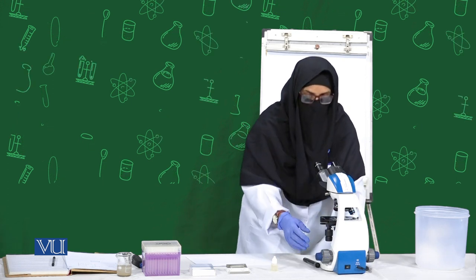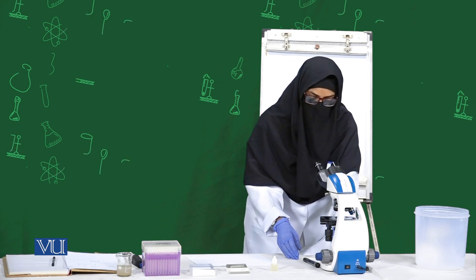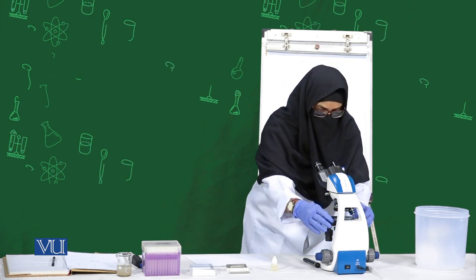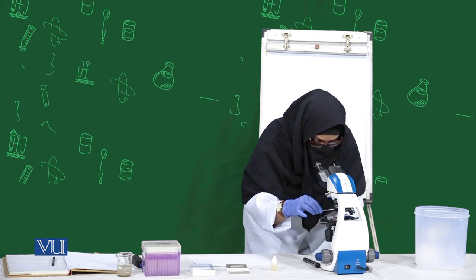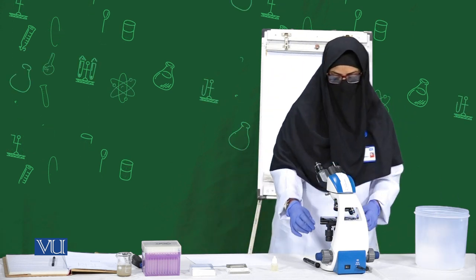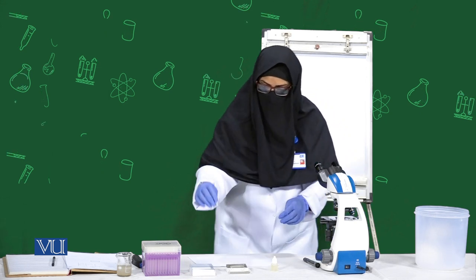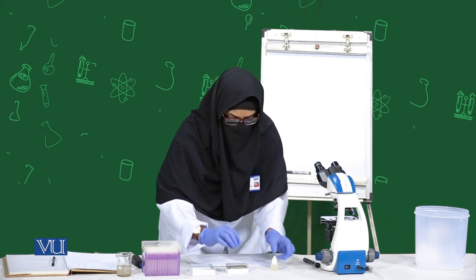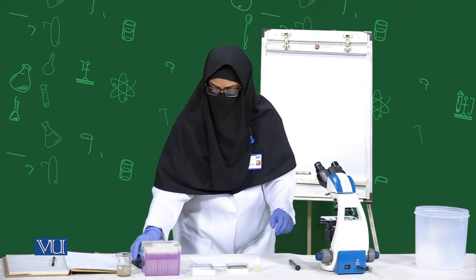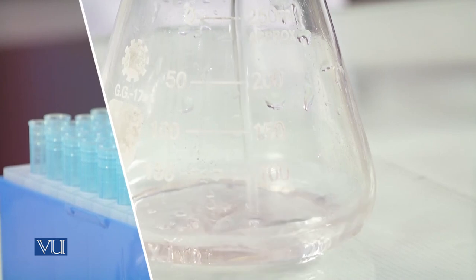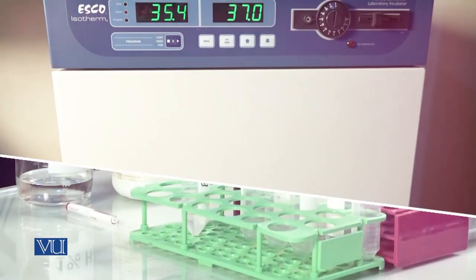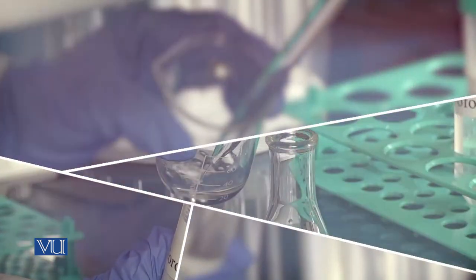So dear students, in this way we are using the wet mount for proper observation of the organisms. At the end we have to prepare the desk for next user. We will discard and prepare our desk, and leave all the information in the book. Thank you.